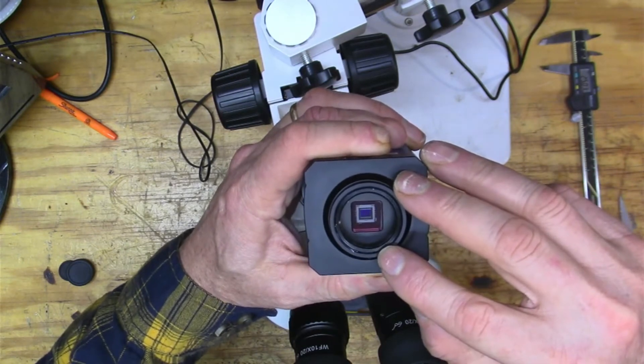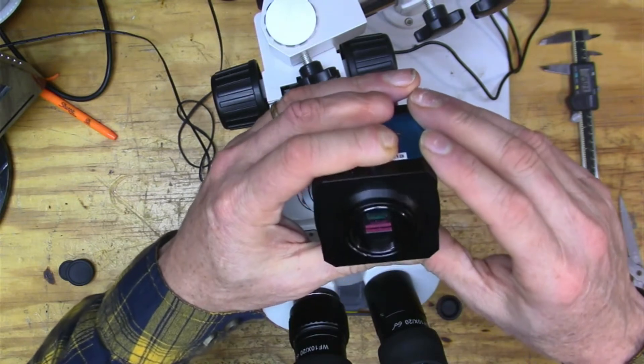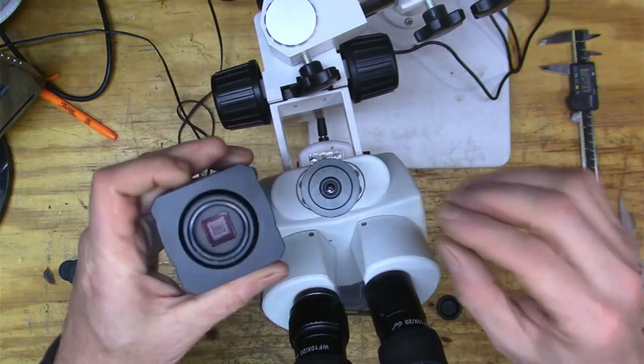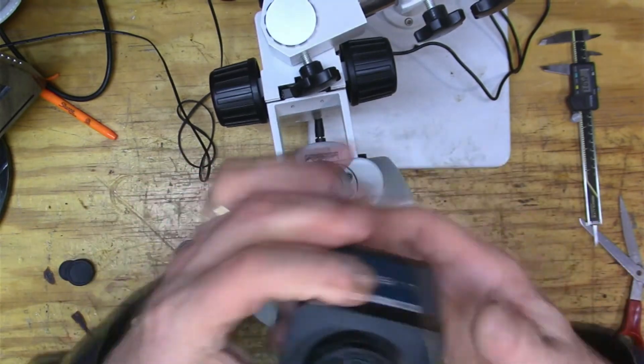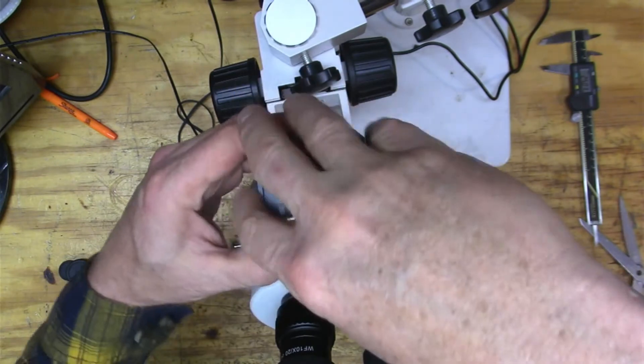Right, so then I've got my camera, right? And this camera, you see the size of the imager in there? And I think that's one over 2.3, so about a half-inch imager. So this thing takes the image from the microscope and gets it so it works pretty good with this camera. So let's just take a look.